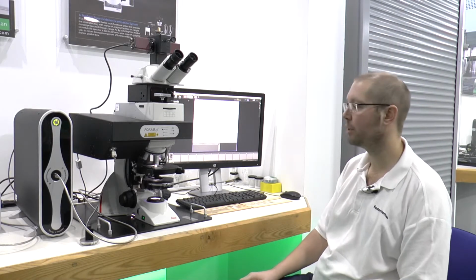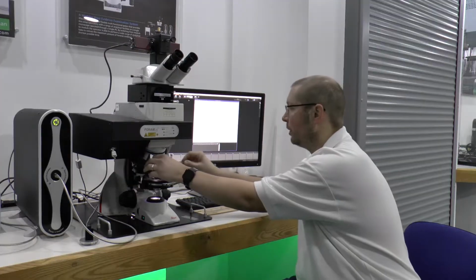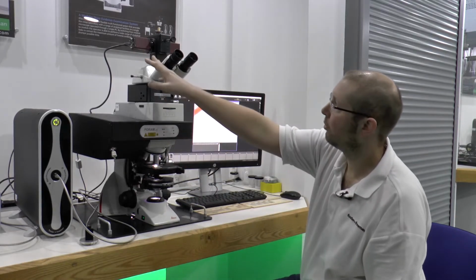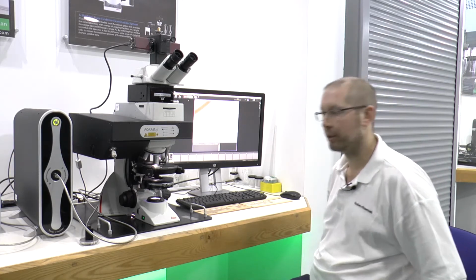So now we're going to take a look at the FFTA imaging suite. This is, again, custom software, originally designed for our video spectral comparator systems and adapted for our FFTA microscope system. The imaging suite allows us to take advantage of the 5 megapixel GigE camera to allow us to take high resolution images, and also calibrated measurements of our trace evidence.